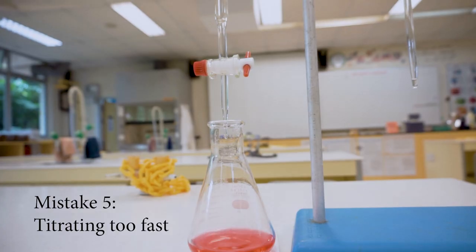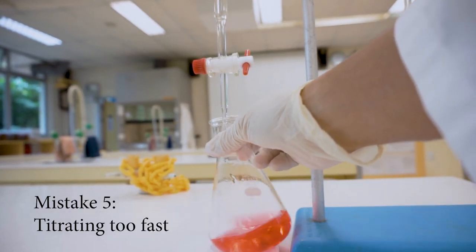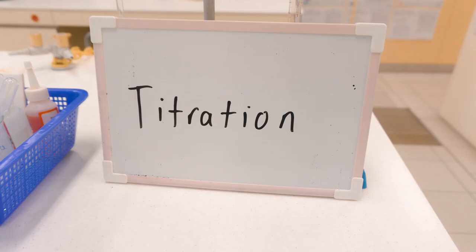Please keep in mind that these 5 mistakes are not the only mistakes that students often make during titration. Please listen to your teacher while they go through more mistakes that students often make for this experiment.